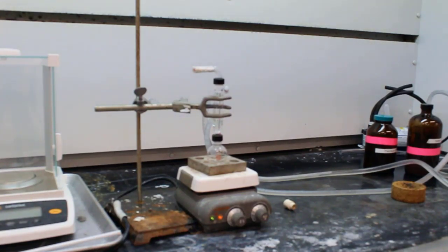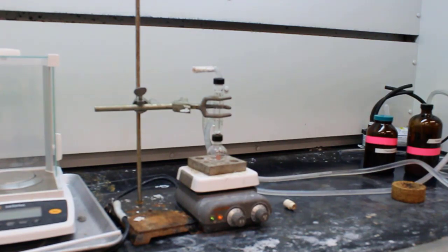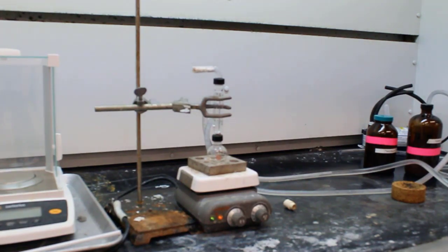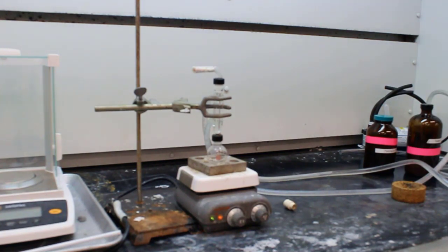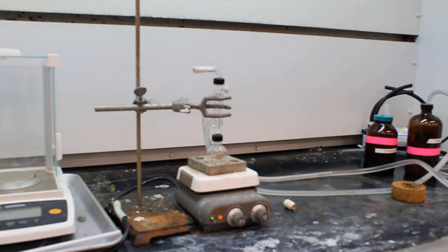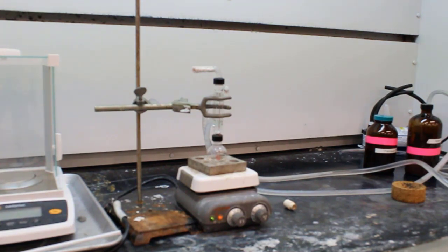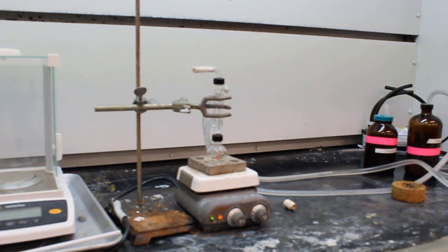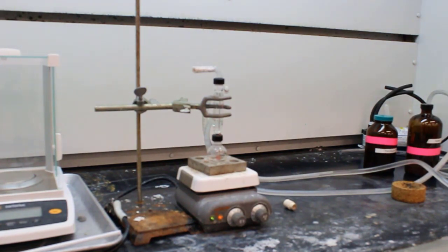Just to keep in mind, this is very toxic. So we want to make sure that we do keep the sash down, and you're going to see that happen here in a little bit after everything has properly dissolved in our heated solvent.